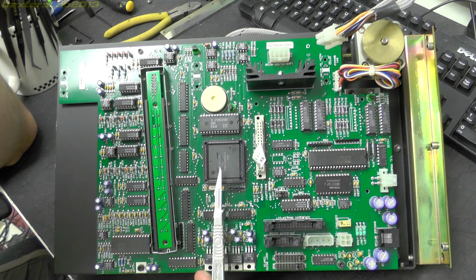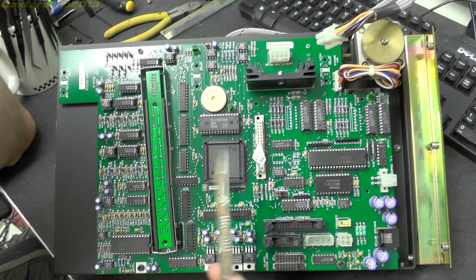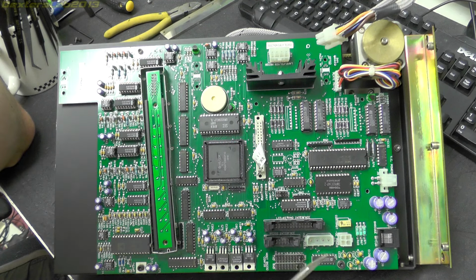It has 2 channels of serial I/O, an 8-bit 2-channel digital to analog converter, 58 I/O lines, 8 input lines, 9 interrupt lines. It also has an A to D converter as well, 8-bit resolution. So obviously that wasn't good enough for what they were doing here, and they've used the separate A to D converter. So it has 8 channels of AD at 8-bit, which is quite impressive. So yeah, quite a powerful little unit, that one.